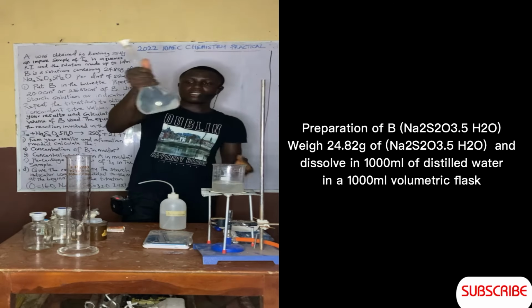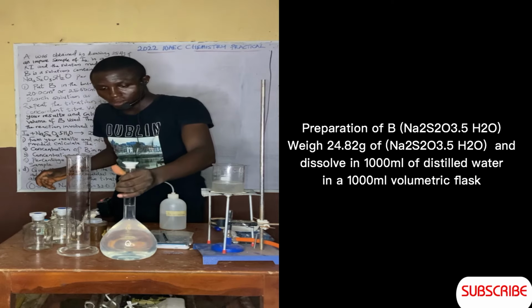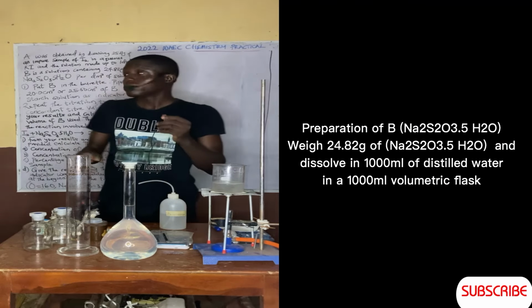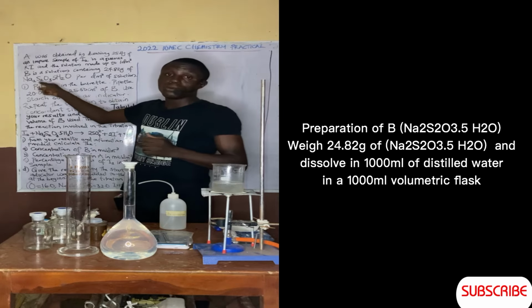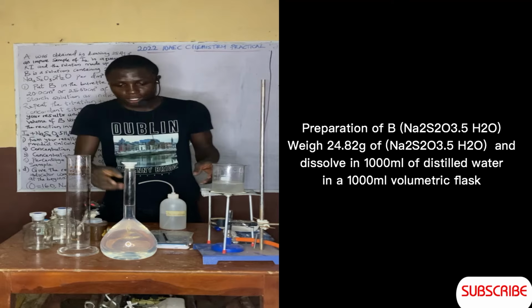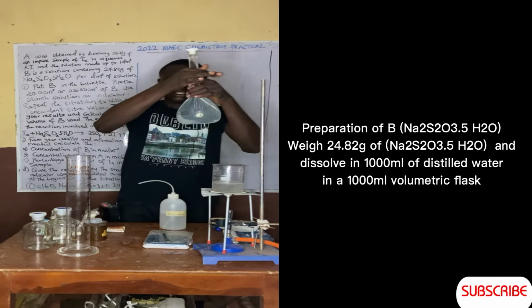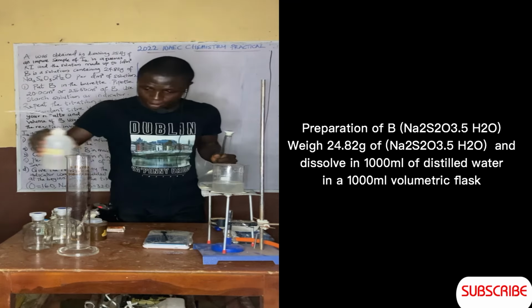So this is Na2S2O3 dot 5 water, sodium thiosulfate pentahydrate. So now let's pour this one into another container so I can make use of this to prepare my iodine solution.